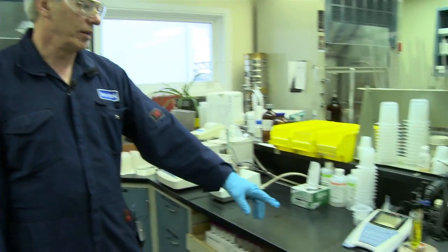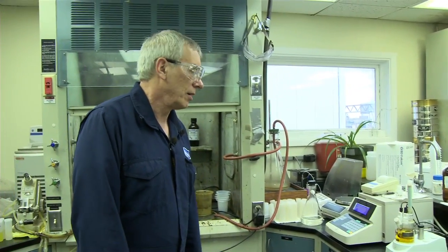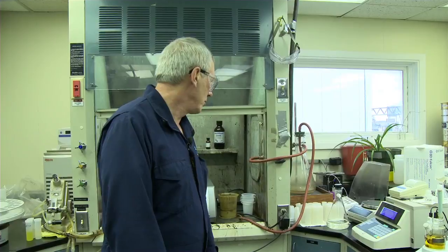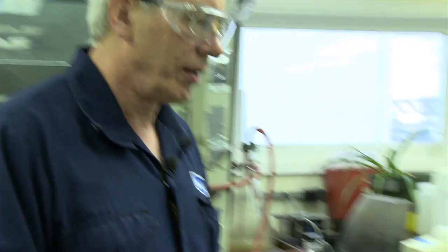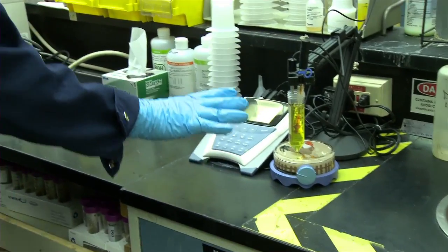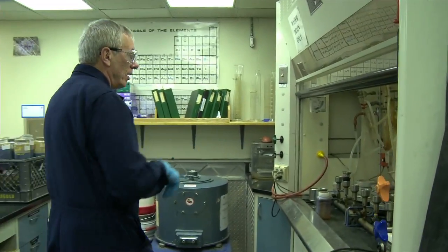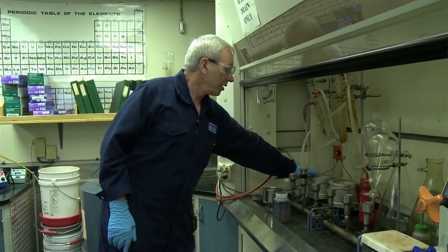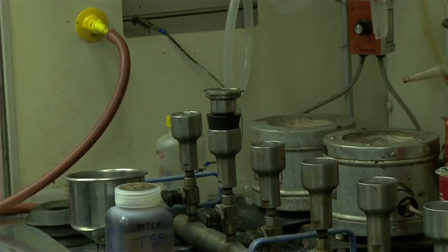Over here I'll run pH on them, so I'm pretty much all set up to run those two. For a glycol, I'll run percent water, pH, and sometimes I'll also run TSS again, and this here will give me the ability to run percent hydrocarbon in TEG.